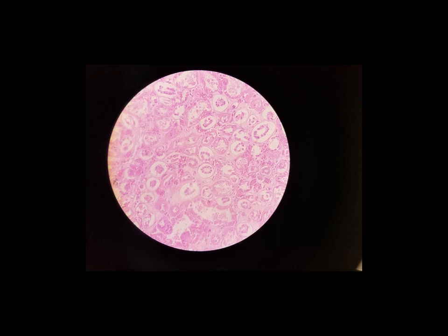Our next tissue type is simple cuboidal epithelium. And again, remember, when we hear the word simple, it means it's one single cell layer thick, and cuboidal describes the shape of the cells. So in this case, cuboidal doesn't necessarily mean it's a perfect cube, but it tends to be about the same height as the width. So rather cube-like. So we're going to be looking for something about like what I'm drawing right here.